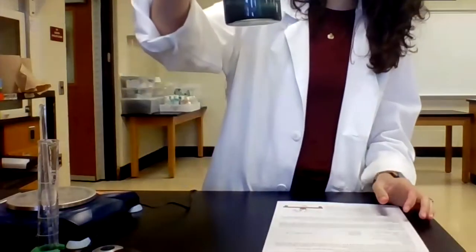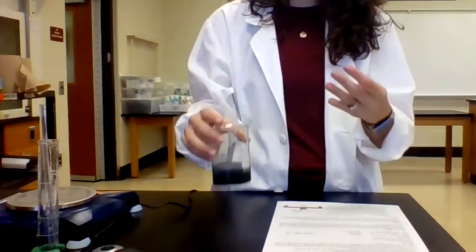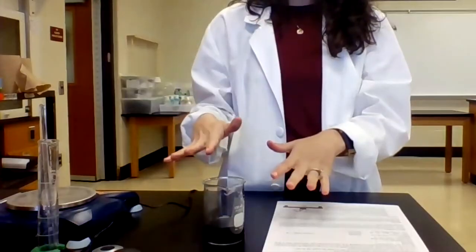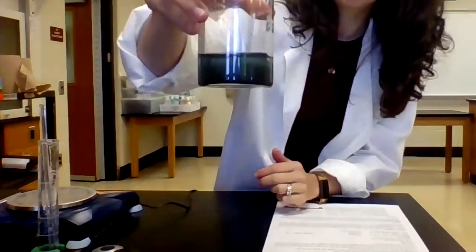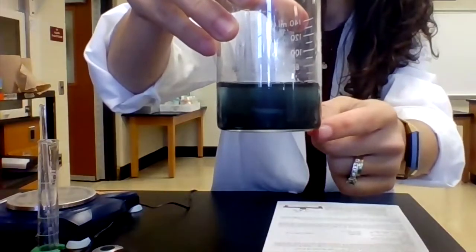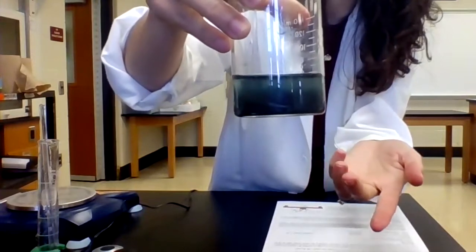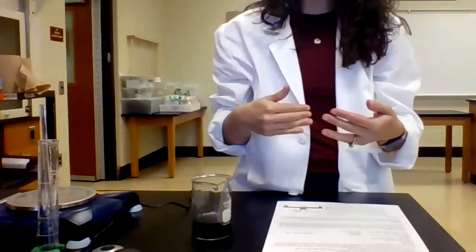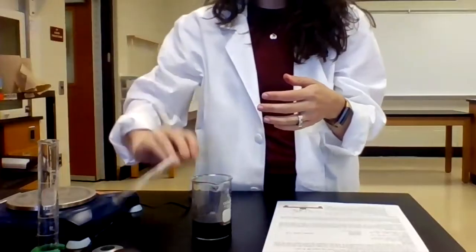So with the copper oxide, it can be difficult to tell if it's all dissolved because of the dark color. So one of the things that you can do is you stir for a while, but then let it settle and see if some of the solid starts to fall to the bottom. And so what you can see here, see how it's lighter up top and it's darker down below? So what that's telling me is that there is still solid, that it hasn't fully dissolved. So now I need to continue with step 4 and add a little bit more hydrochloric acid because I need to get all of this to dissolve.